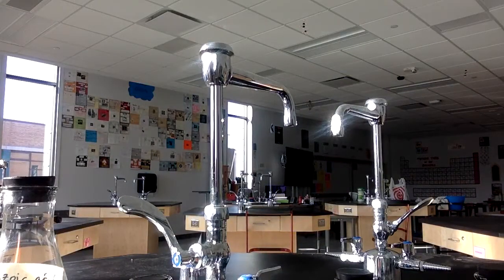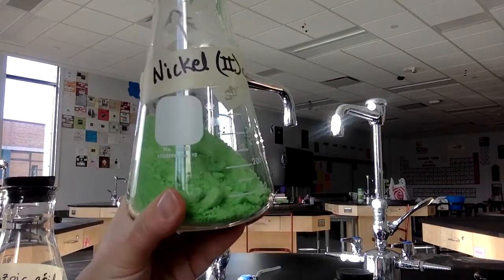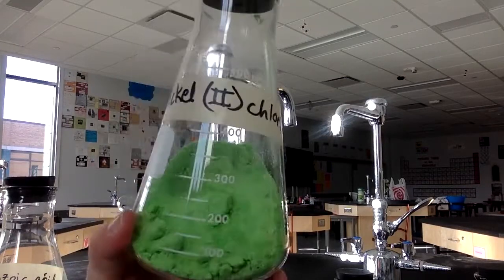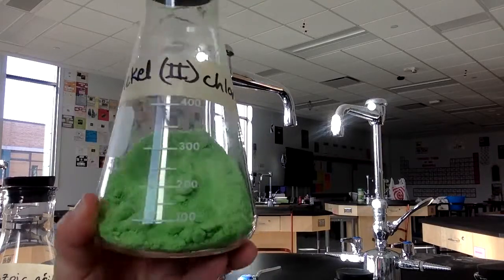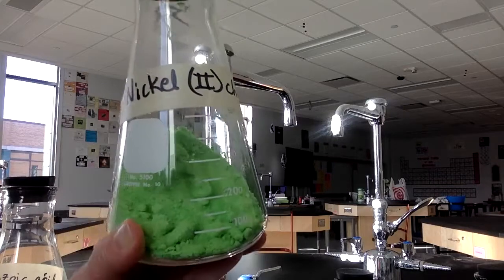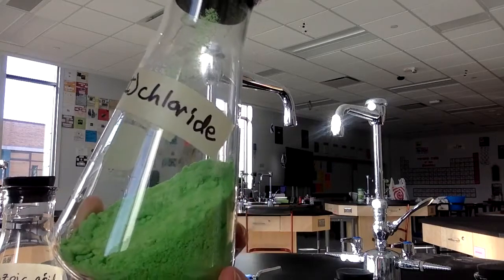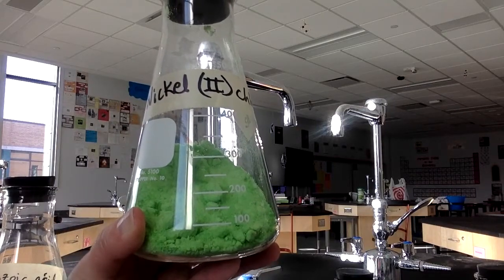One more sample I want to show you, so that you start to get a comparison of these different moles, is nickel chloride. So something totally different looking. So nickel(II) chloride. Nickel is the metal. The Roman numeral tells you what the charge is. So I'm giving you a big hint, the fact that these are dealing with charges. And then chloride, remember, is just the element chlorine. Put those pieces together to get the chemical formula.